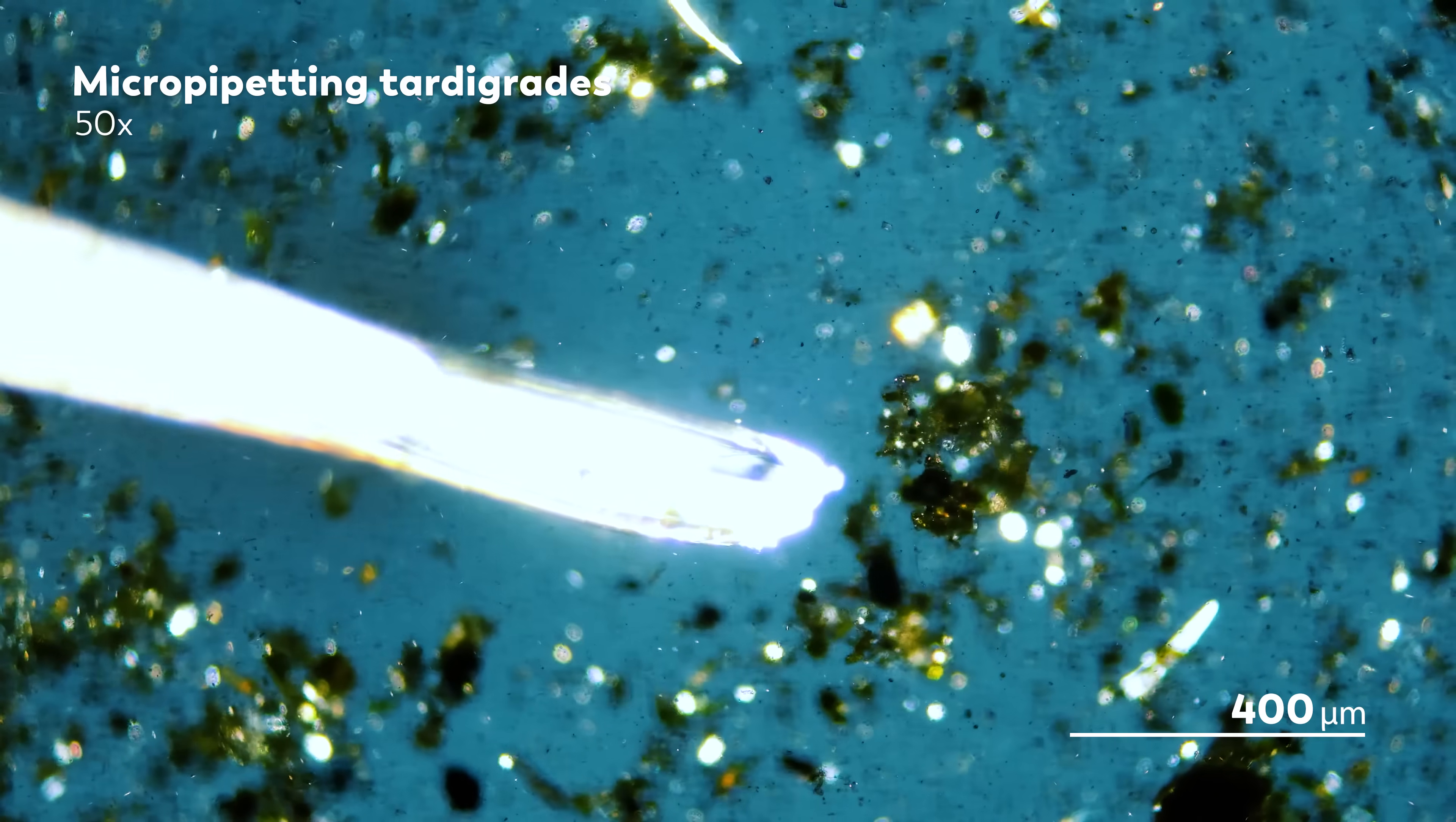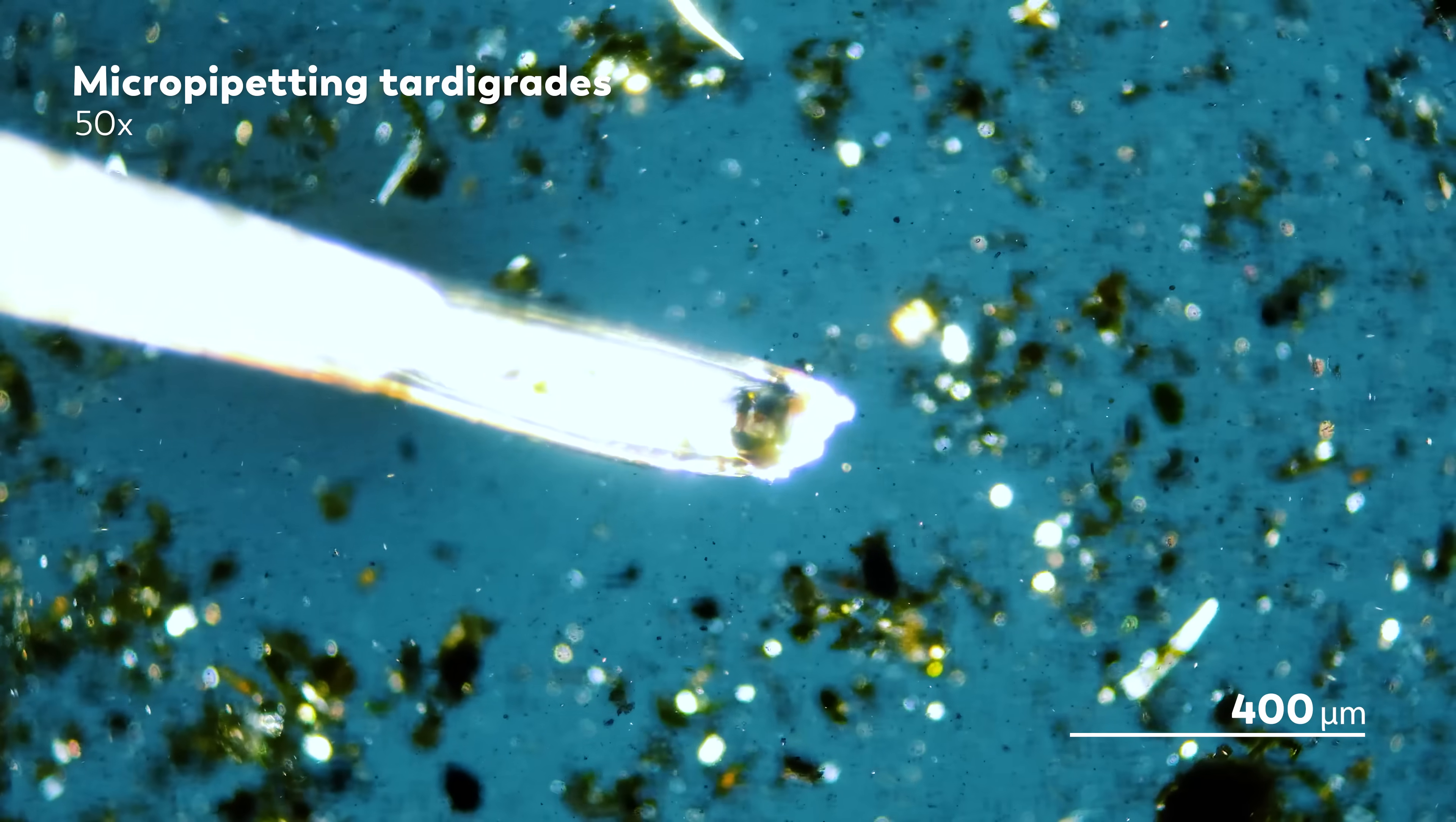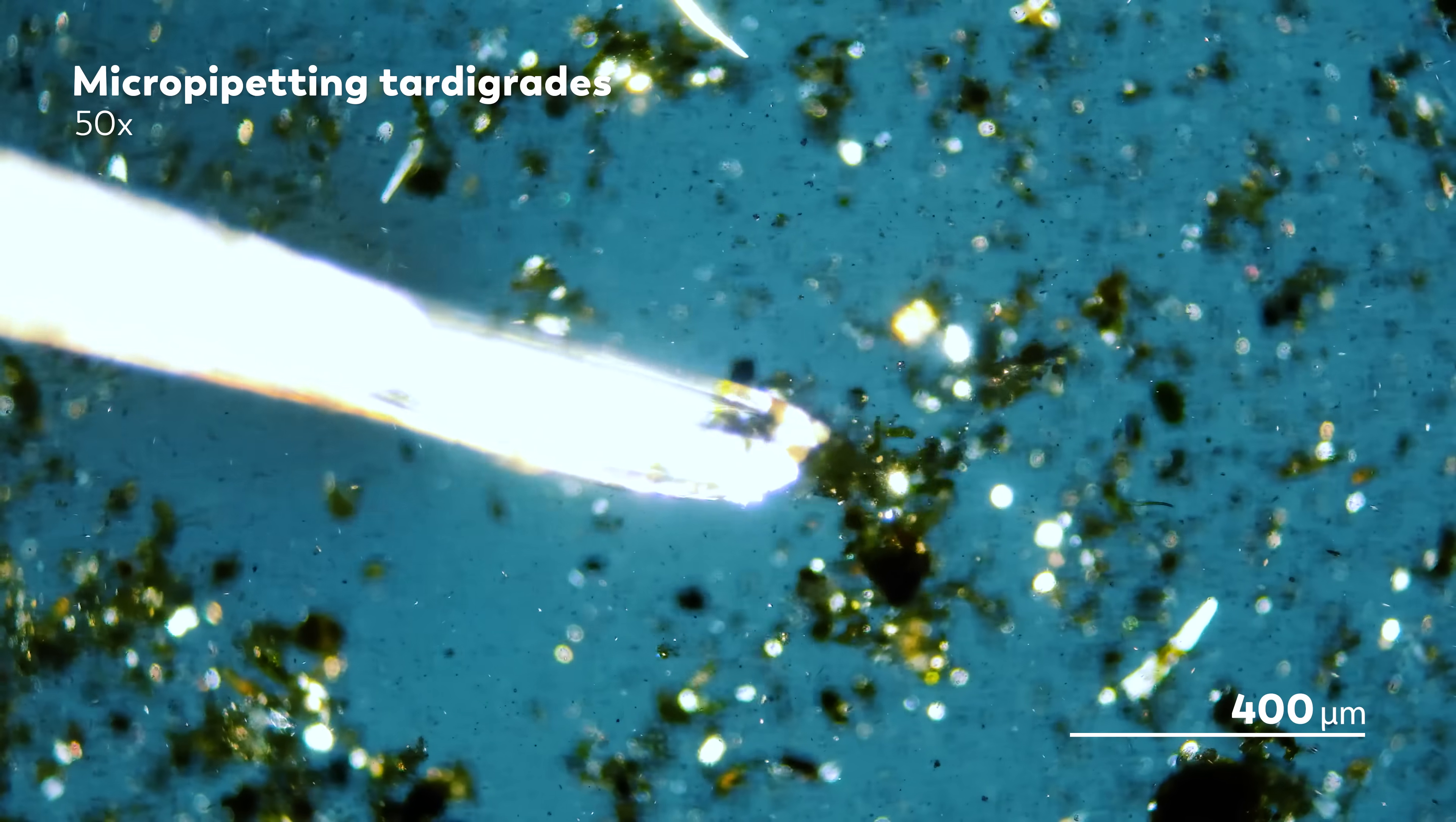It's tough work, you know, trying to chase a microbe around a slide with a pipette. In the beginning, he kept losing cells. But eventually, our master of microscopes also became a master of micropipetting.